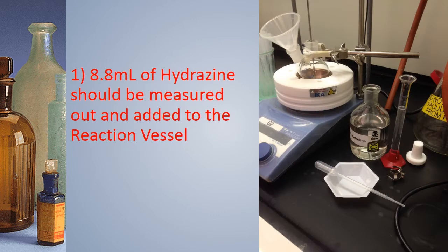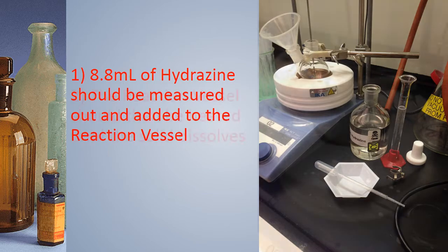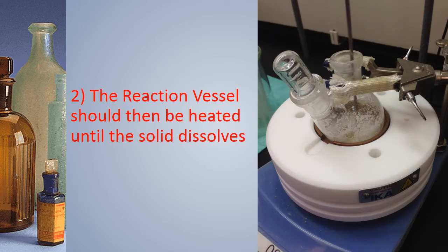8.8 milliliters of hydrazine should be measured out and added to the reaction vessel. The reaction vessel should then be heated until the solid dissolves completely.